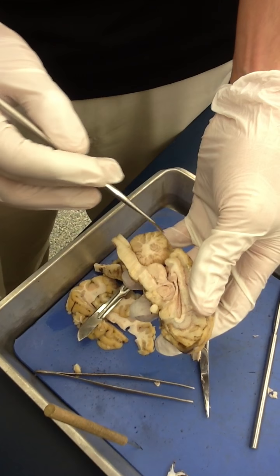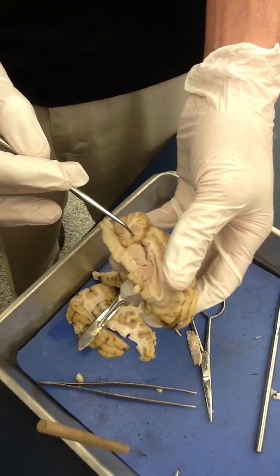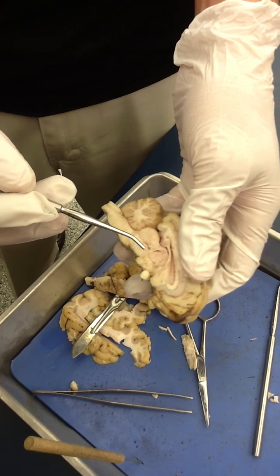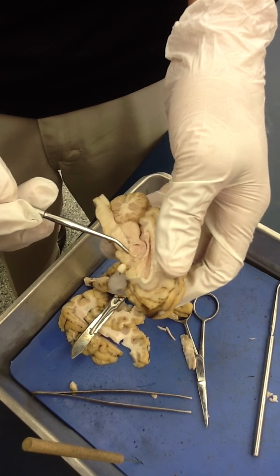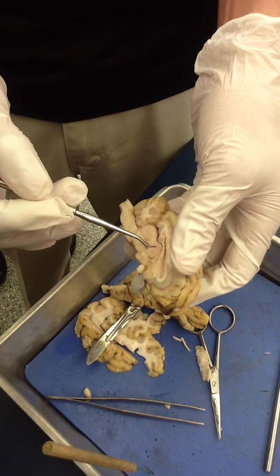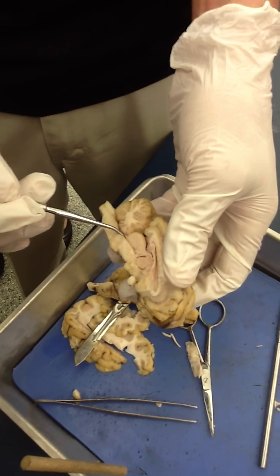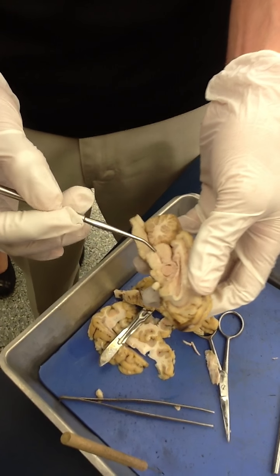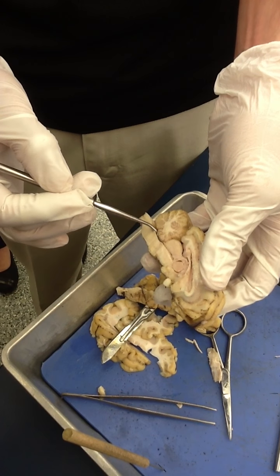We might as well go ahead and identify our cerebellum. The white tree that we see in the cerebellum is the arbor vitae. We can go ahead and finish up our ventricular system. The third ventricle is the space between the two halves of the thalamus, leading to the fourth ventricle via the cerebral aqueduct. Third ventricle would be here, fourth ventricle here.